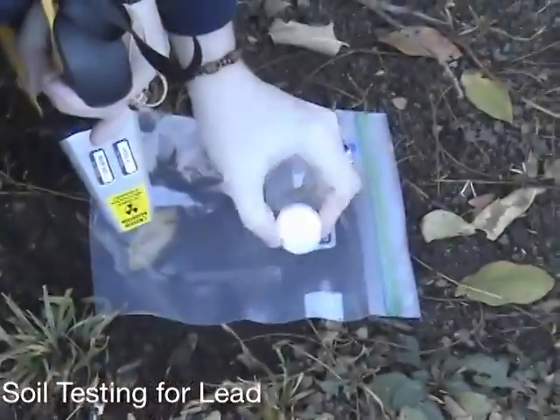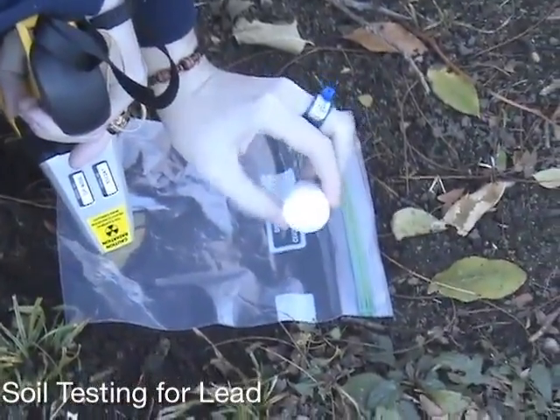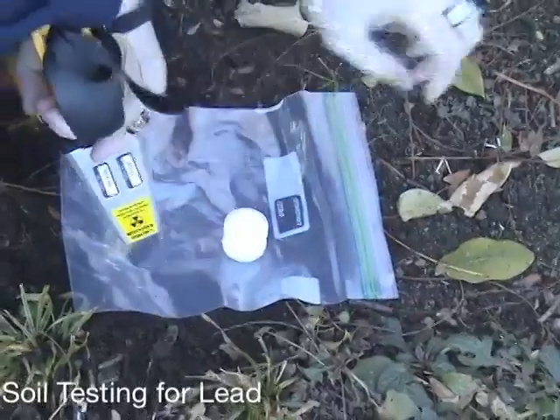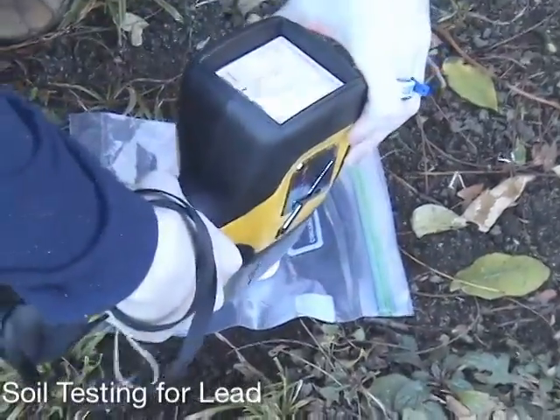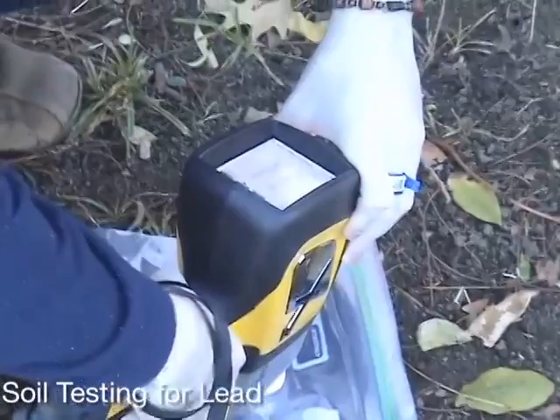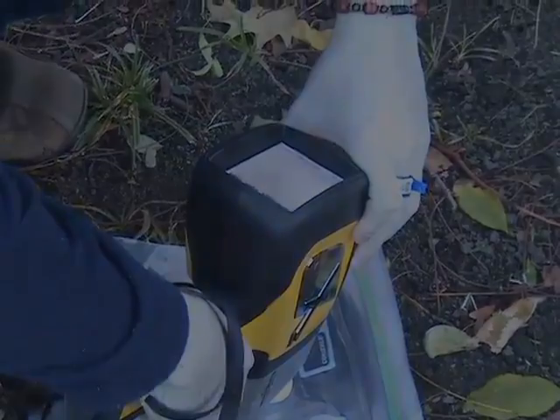It's always a good idea to bring a sample cup of pure silica to confirm that there's no transfer from sample-to-sample or to the analyzer window. No lead should be detected when measuring the pure silica.